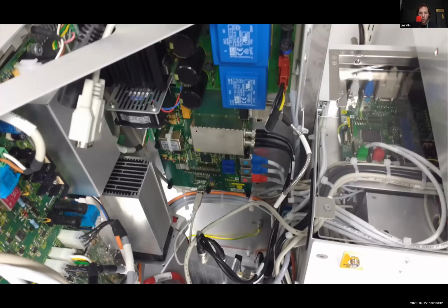These are control boards or RF readout boards that are sending or receiving information to the various devices. And there's also a computer in here that does some number crunching before communicating with the computer outside the mass spec, which is the one we interact with.